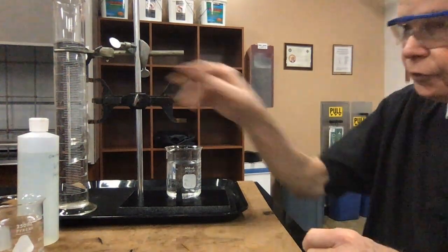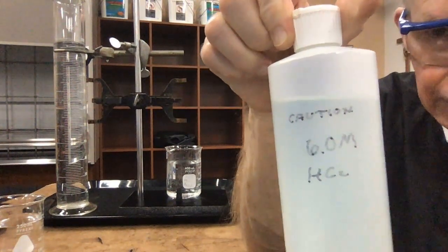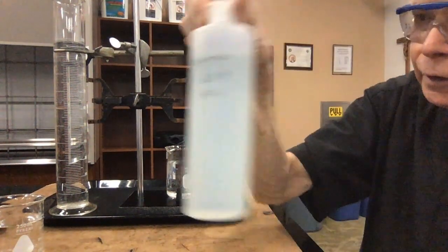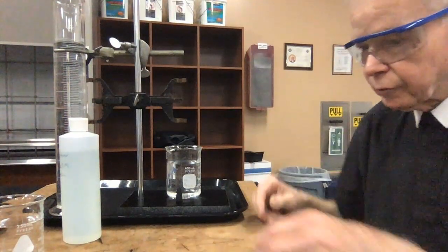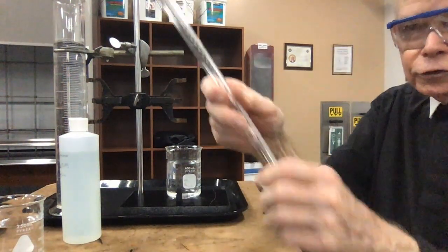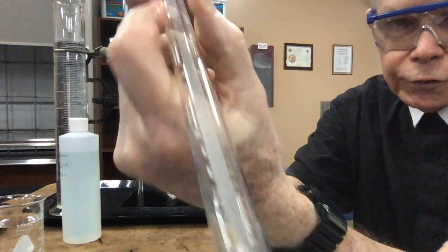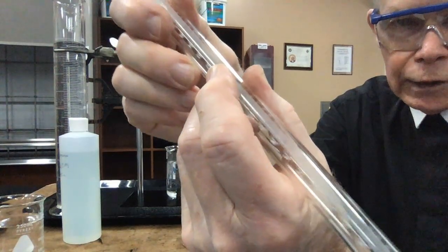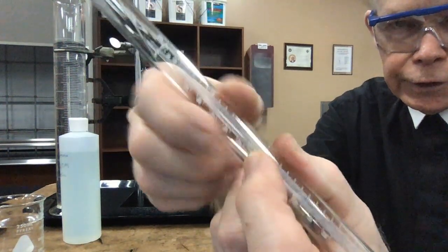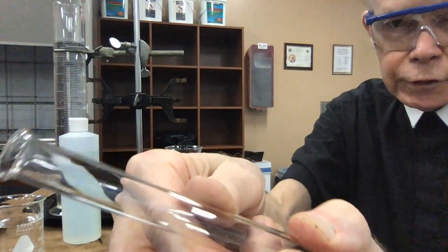The reaction is going to take place. I'm going to use some 6-molar hydrochloric acid, and you can see that on my bottle here. The reaction vessel that I'm going to use is a large glass tube. It's closed on one end, and you can see that, but then when I move it down through all the graduations to the other end, the other end is open, and I'll be able to put liquids into this.